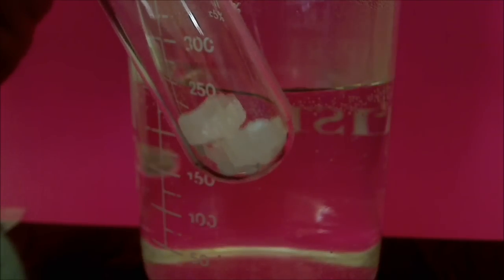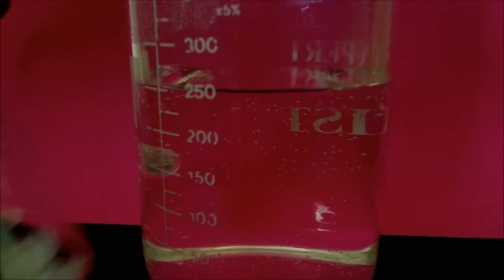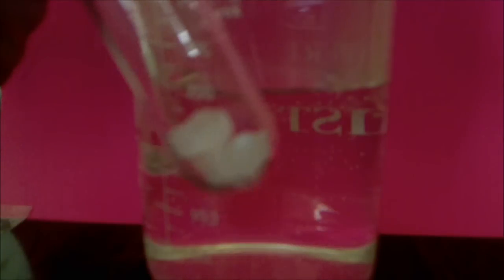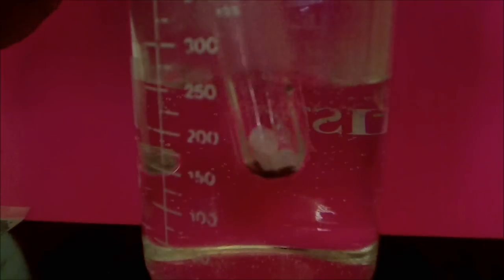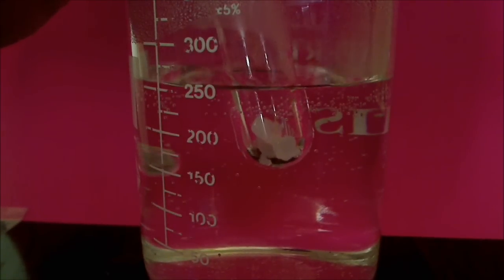The other nice thing about it is that it dissolves in nonpolar solvents such as acetone. So I'm going to demonstrate that later. But first, let me immerse the mothballs, the paradichlorobenzene, in hot water, which I have behind here. And you will see that it readily melts.